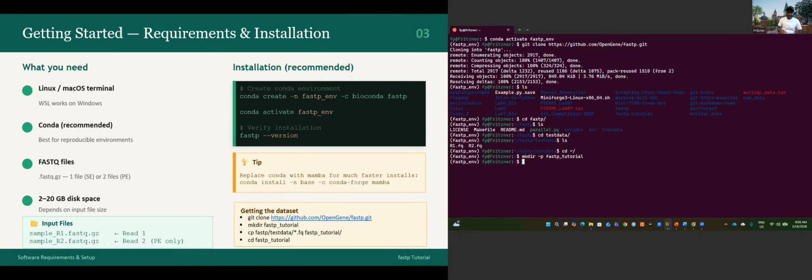Let's copy the files we have in the fastp directory that we just downloaded. Just cp, that's for copy. We go to fastp, then test data. This is where we confirm that we have the data. We have the R1 and R2, which have almost the same format. I will use the wildcard asterisk to copy everything that ends with .fastq or .fq, copying it to the directory that I created, fastp_tutorial.